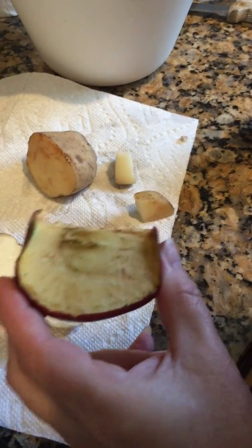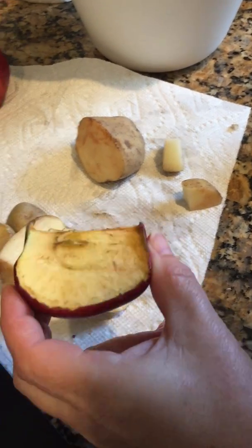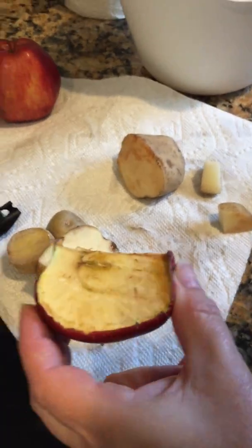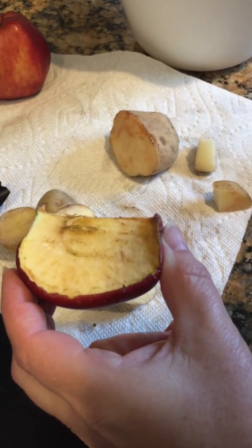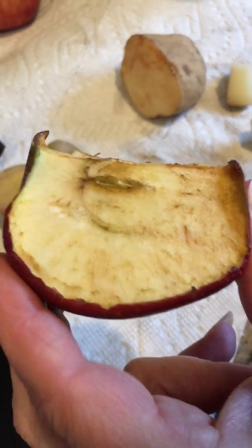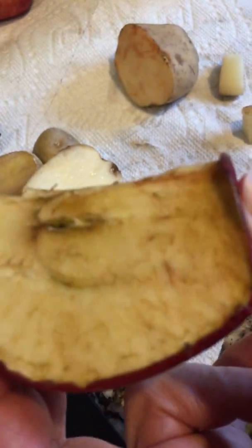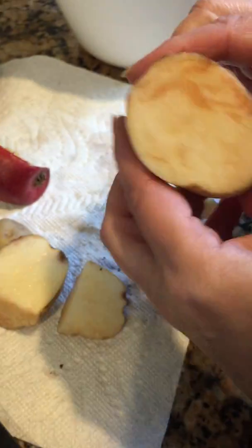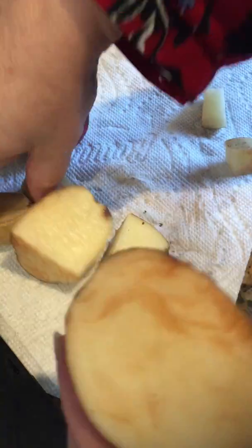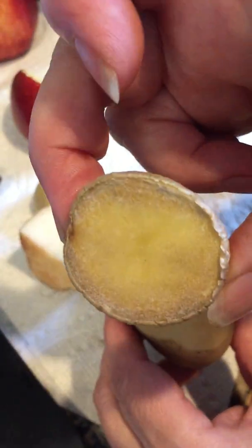The enzyme we're going to use in this lab, lab 10, is called catecholase. It is responsible for the browning effect that you see on fruits like this apple here, as well as potatoes. And you can see it on these potatoes here.